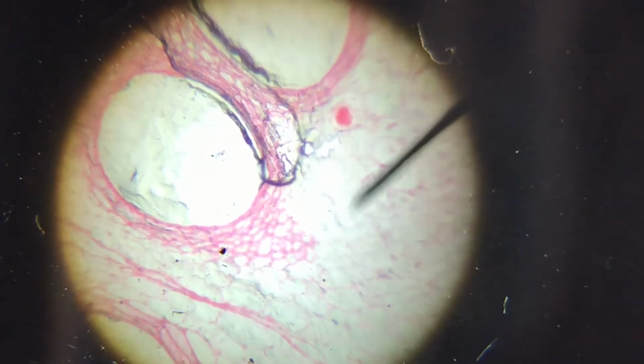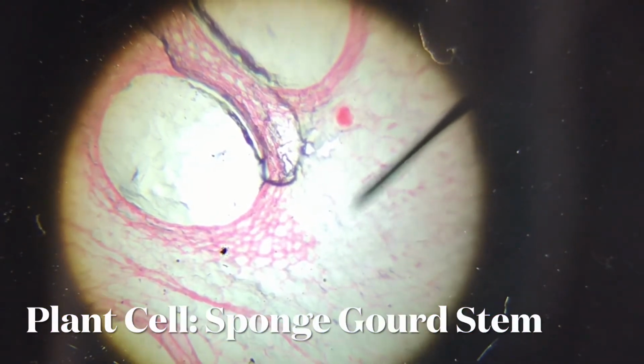Now the next slide we're going to look at is another slide from a plant part. Let me do the adjustment. I did the coarse focus knob adjustment. Now I'm going to use the fine focus knob just to get the image a bit clearer. What you see here is actually part of the sponge gourd stem. So it's the stem from a plant.